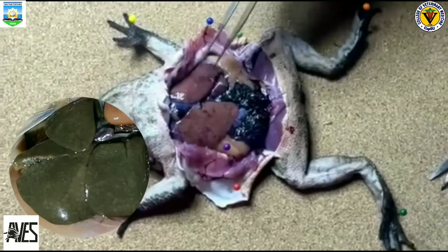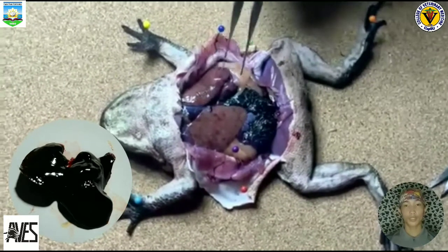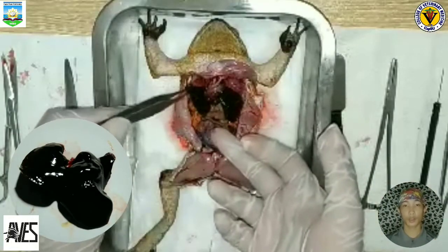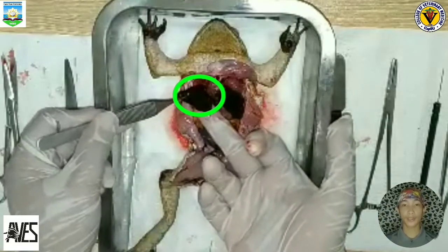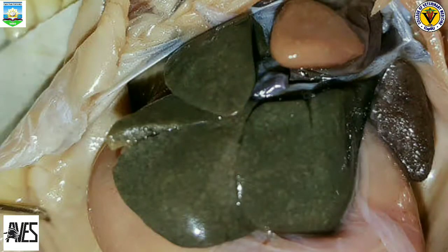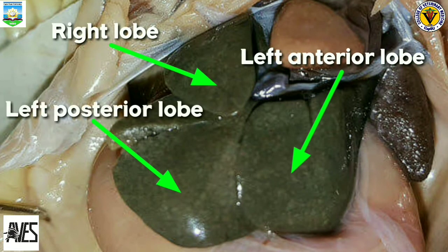So this is the liver of a frog. The liver is the largest organ in the frog's body. It can be located under the muscle layer and just below the heart. The liver plays an important part in the digestion process of the frog, for it produces a fluid which is called bile that helps break down food. The liver is composed of three lobes: the right lobe, the left anterior lobe, and the left posterior lobe.